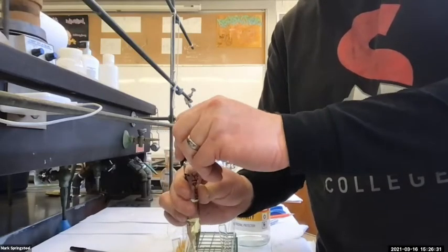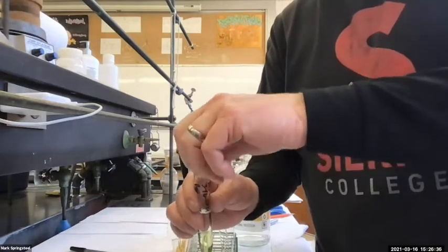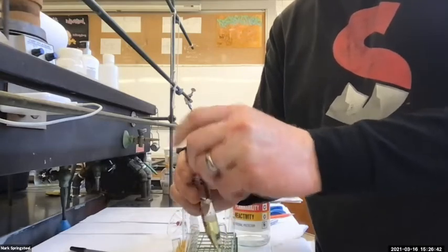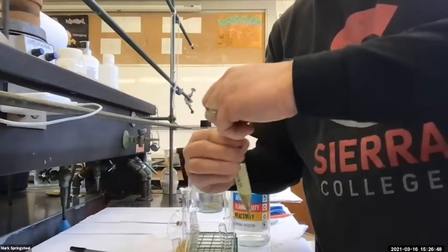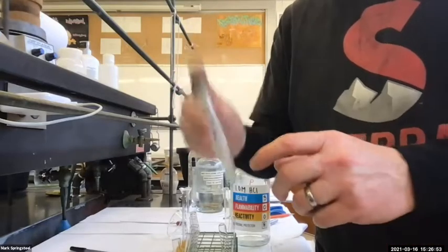Let's hear if we can hear anything. I don't know if you heard it, but I heard just a little bit of a vent. So I'll do that again. And I didn't even hear a vent that time. So I think it's good now. It's gotten through the beginning part. So I'll give it more of a shake, vent. Yeah, I'm not getting any venting. So I can really give it a good shake now.